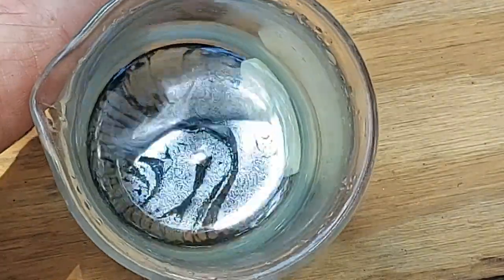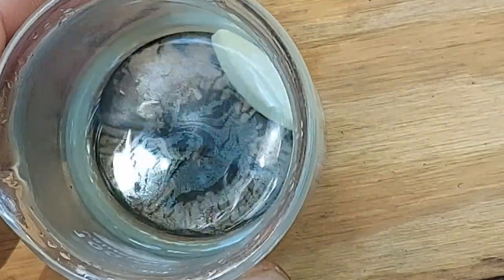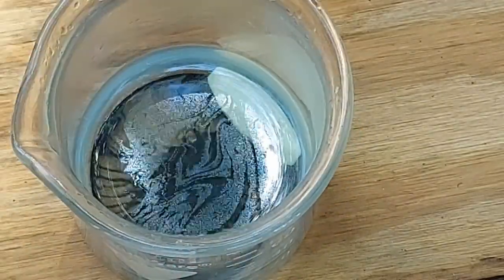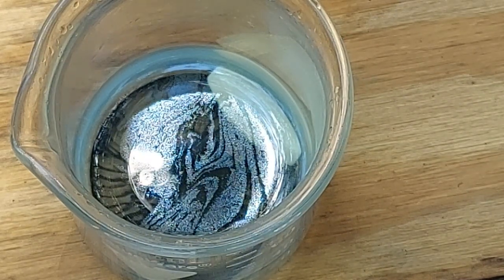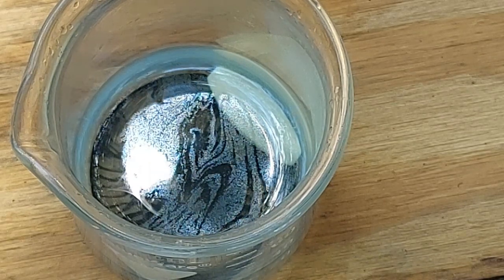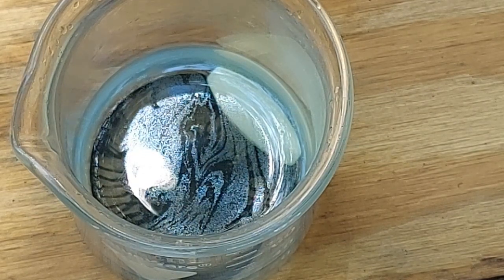Mind you, you see those pictures of like 2 milligrams of fentanyl, and that's all made from light elements. And I mean, it's about the size of the lead on a pencil. This is way more than 2 milligrams. Even if I'm being generous, the lightest thing possible that, so far as I know, won't dissolve in hydrochloric acid would be like elemental boron. But even if that was boron, that's way more than 2 milligrams of it.